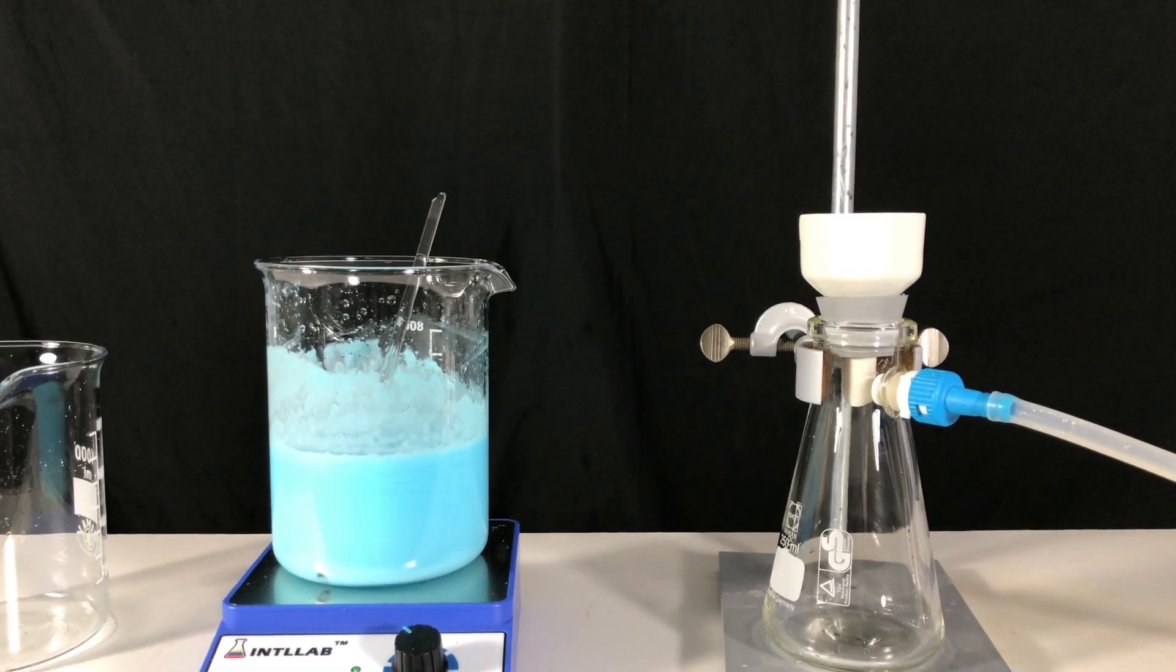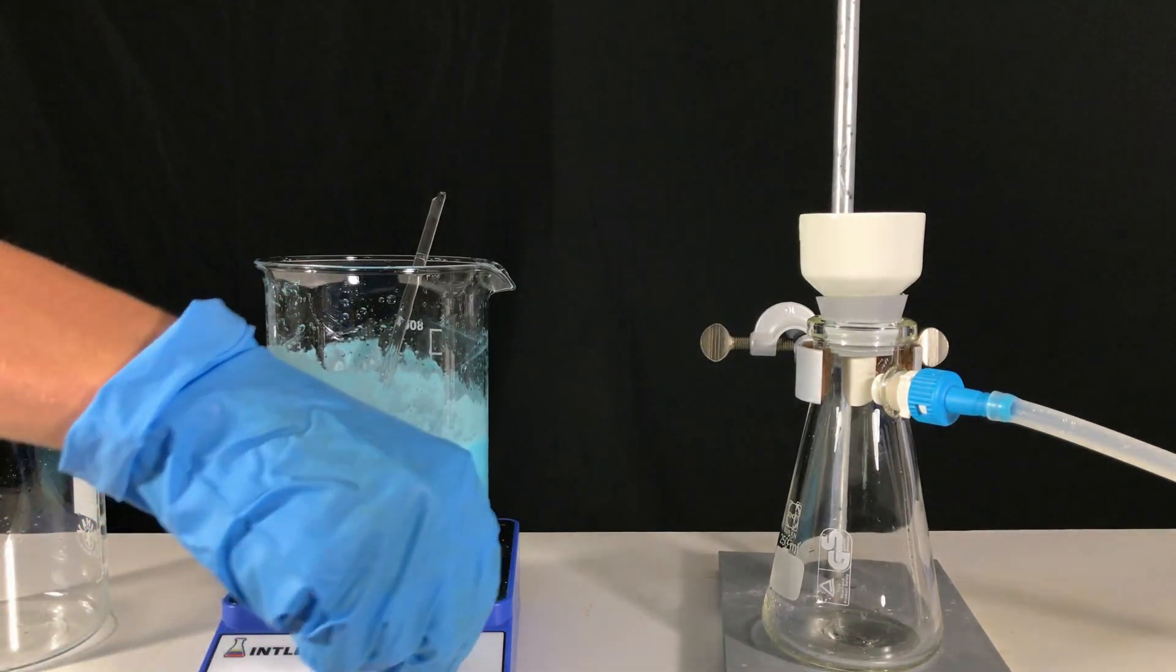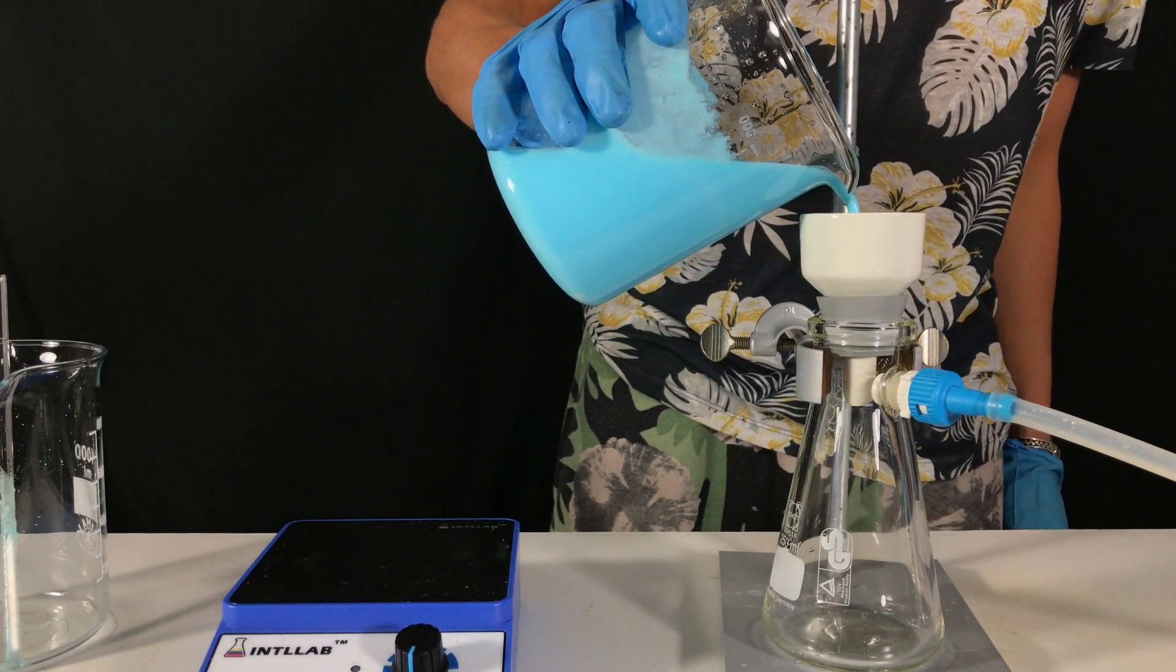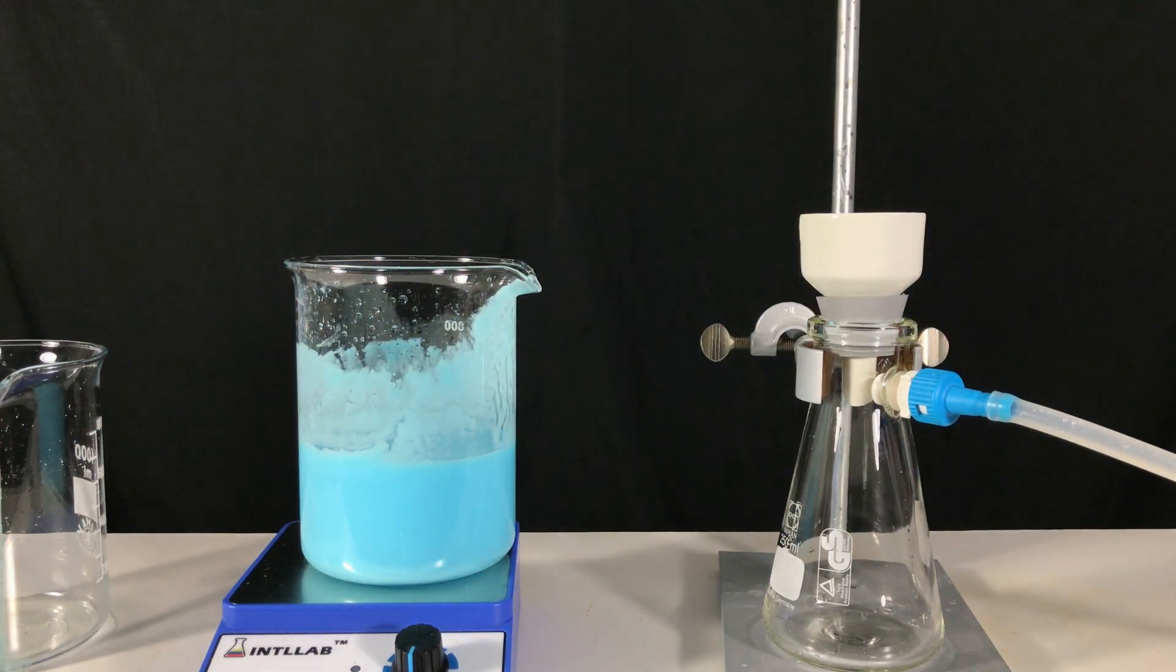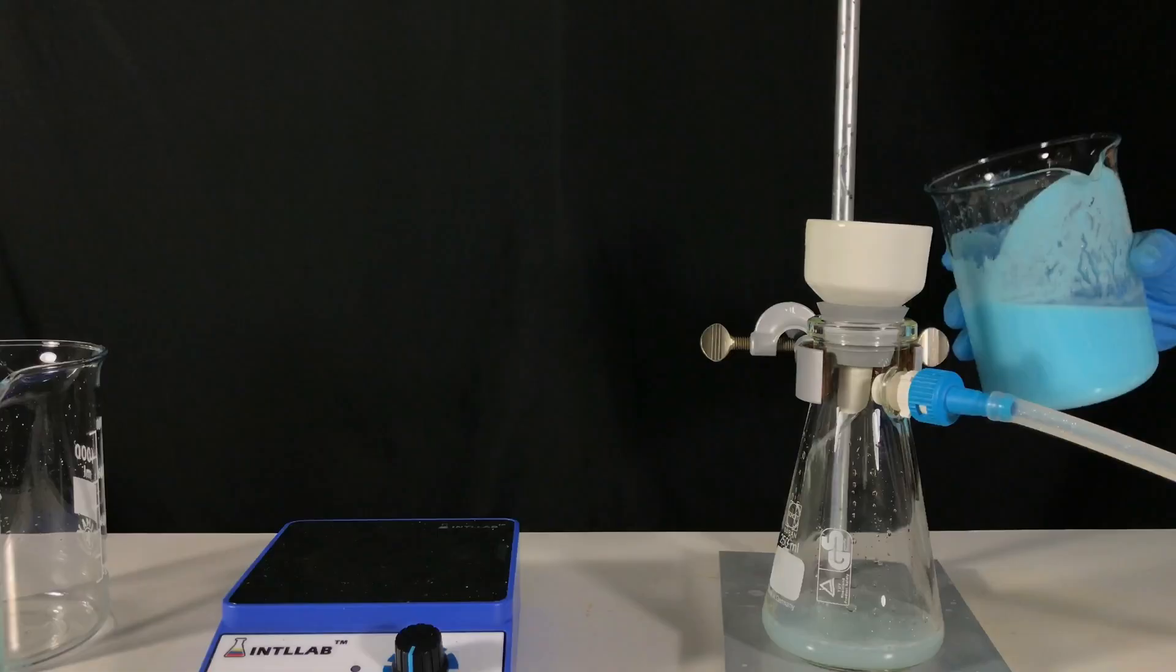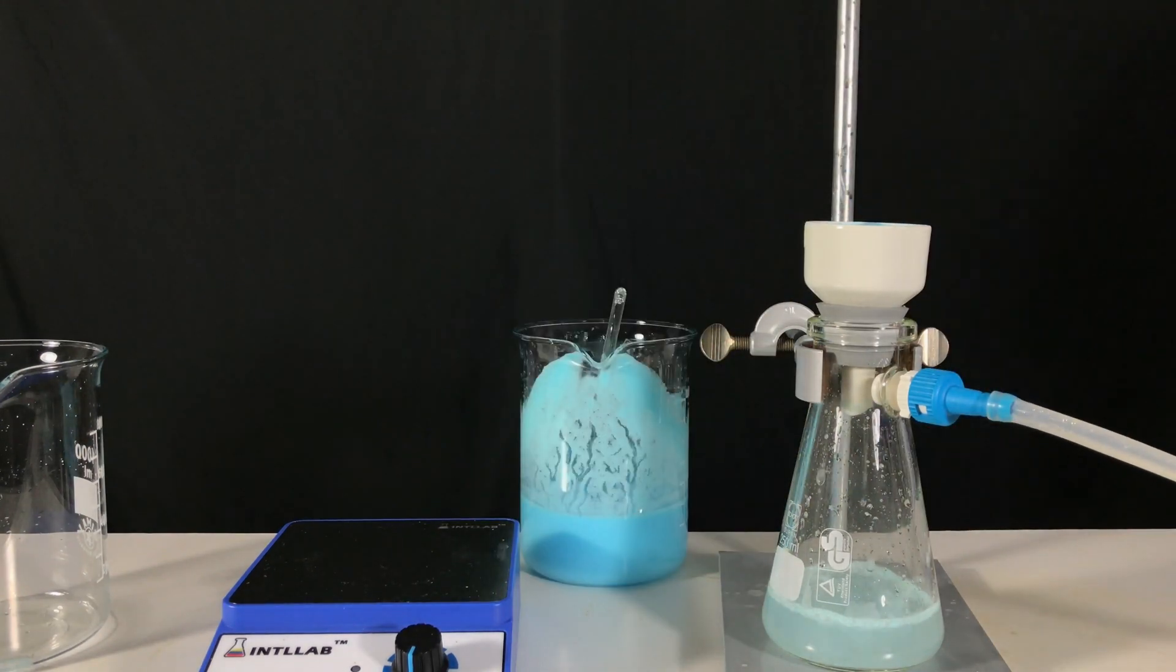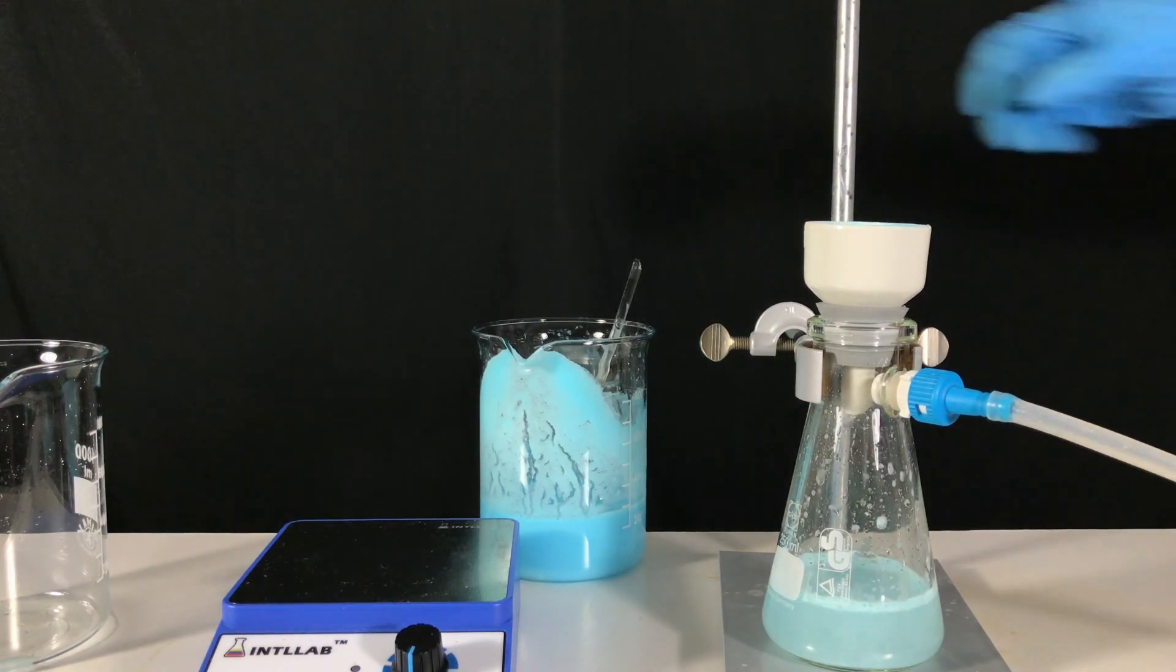After five minutes a vacuum filtration was performed. With the small filtration funnel and a really bad vacuum pump that you were able to see in the last video all of this filtration was really a pain in the ass. Even though it wasn't fun in the end we got everything finished.